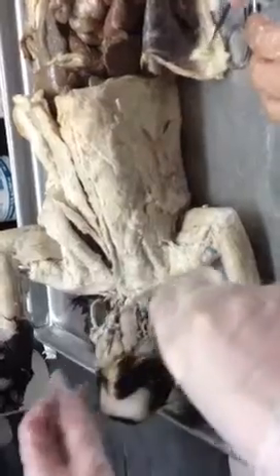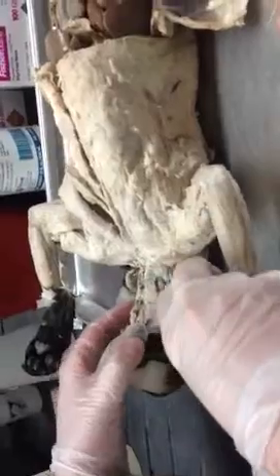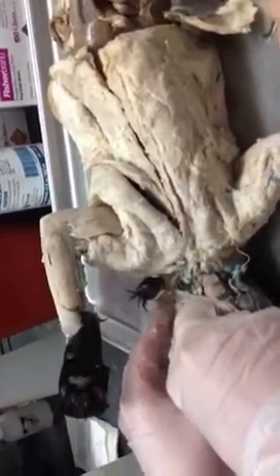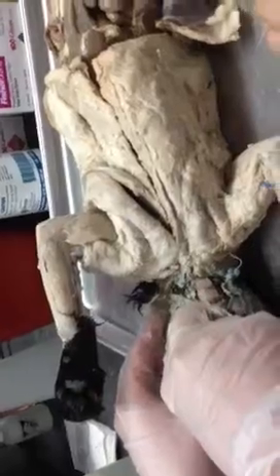So you have the sternothyroid and the thyrohyoid. And then remember the sort of v-neck collar — the part that's medial on this side of the jugular vein is called the sternomastoid, and the part lateral to the jugular vein is called the kleidomastoid. I'll find a different cat for those two.